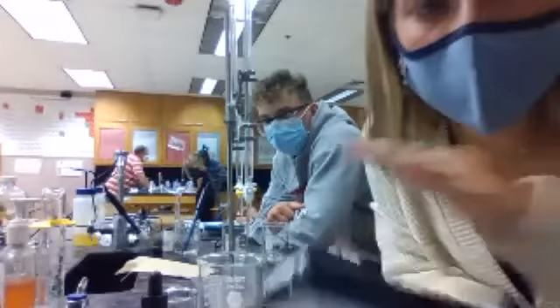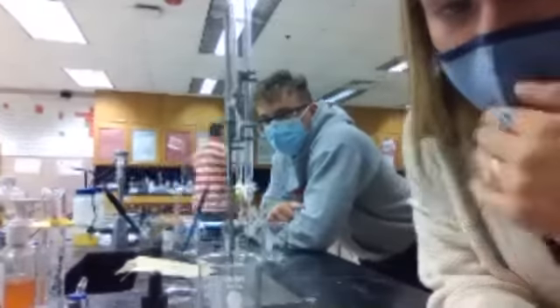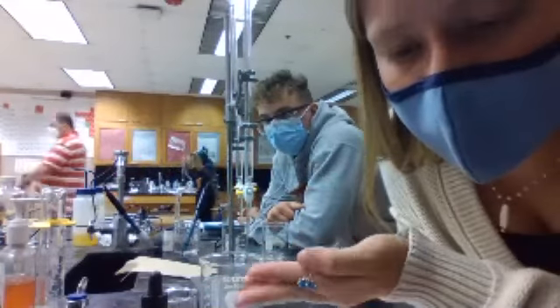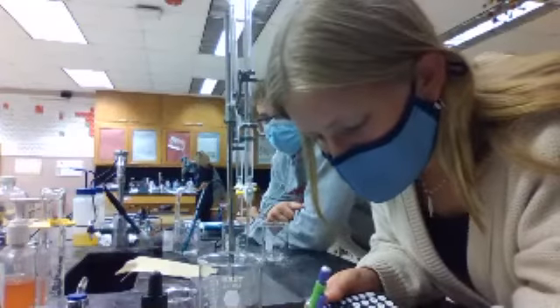So is the actual volume 10 then, if we subtract them? Wait, don't do that yet. I just need the VB, because I need to start doing this. So I just need someone to check Raylan's work. Raylan, I did, and I got 15.67. Is that what you got? That's what I got, but Ramaya is the one who first said something. Sorry, I got 15.67 as well. Okay, 15.67.